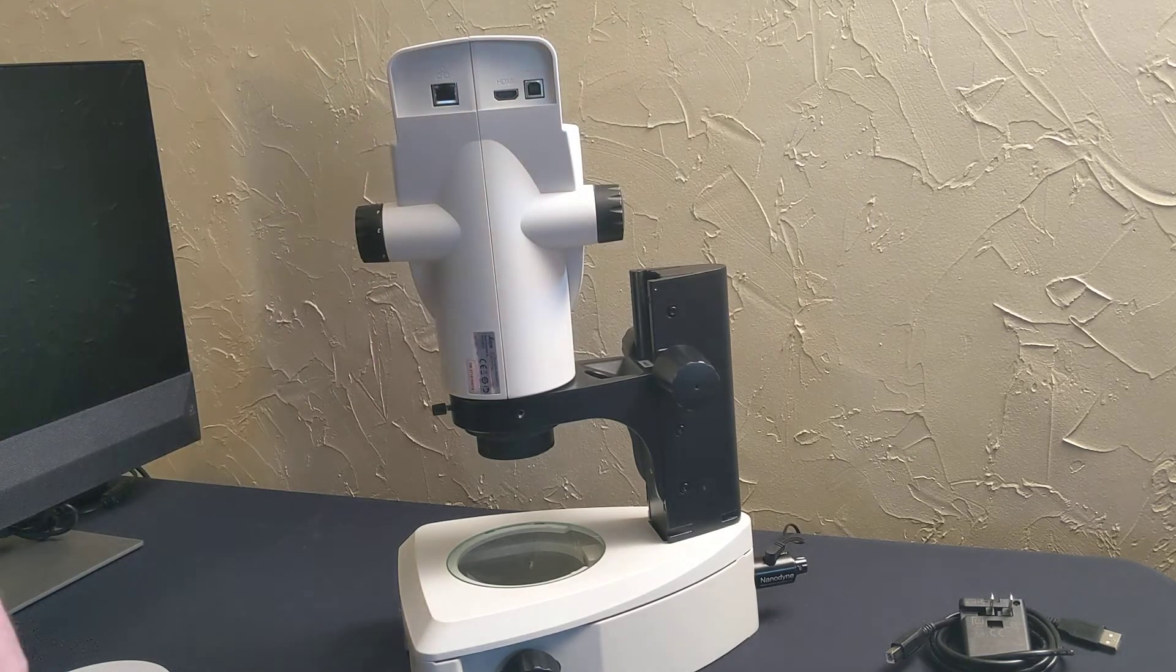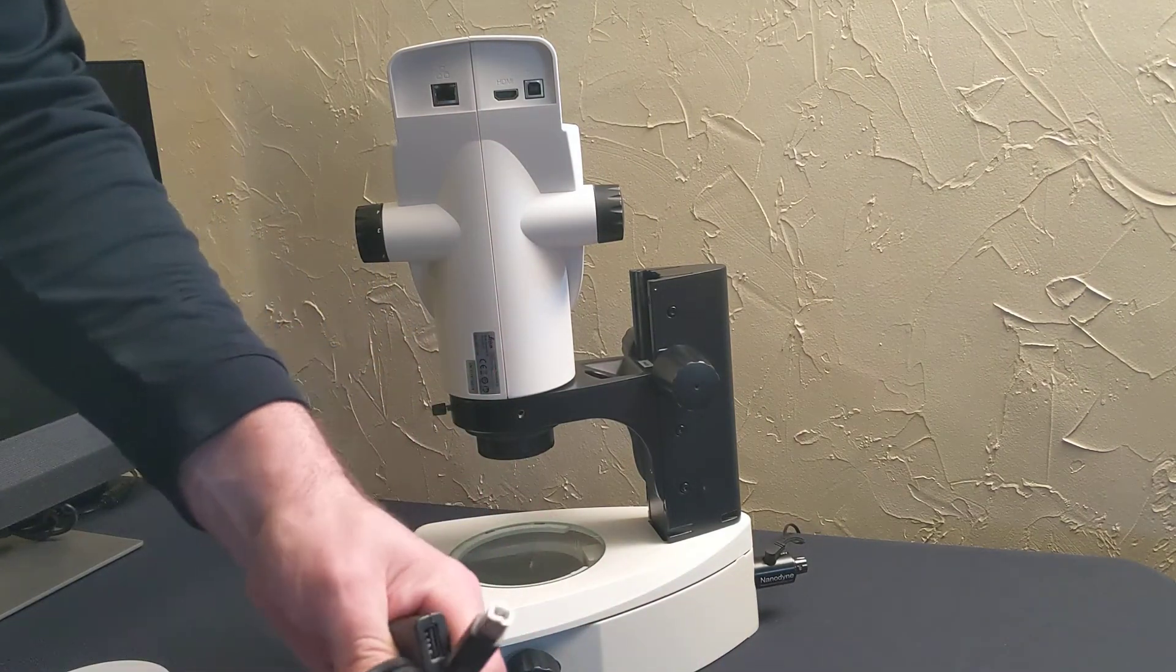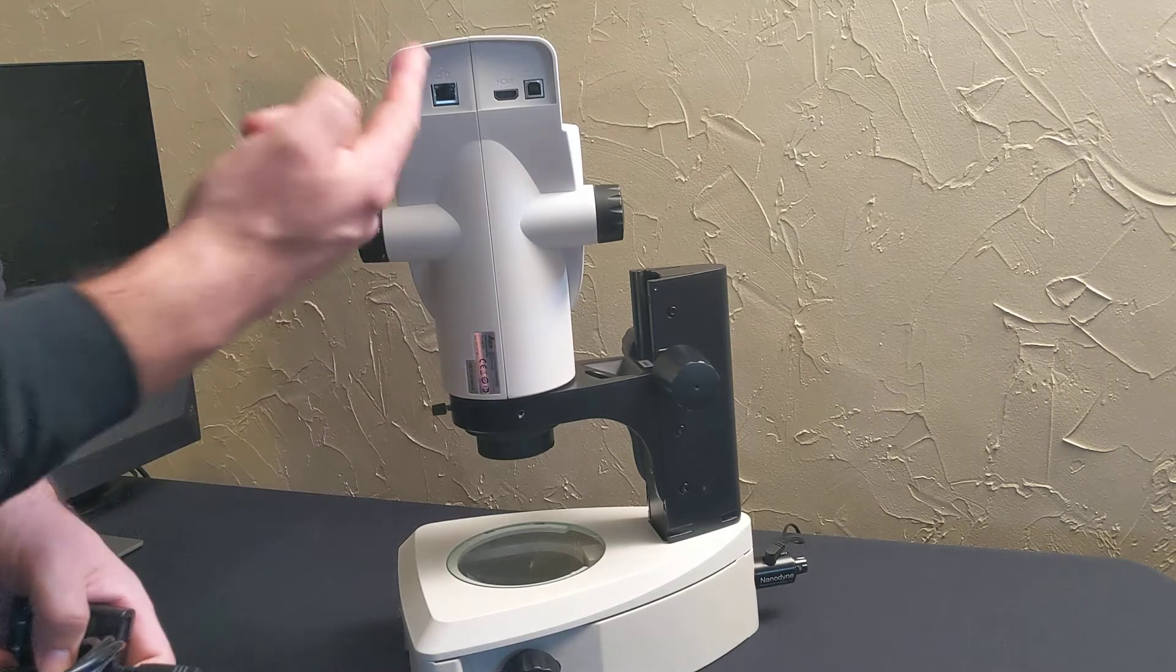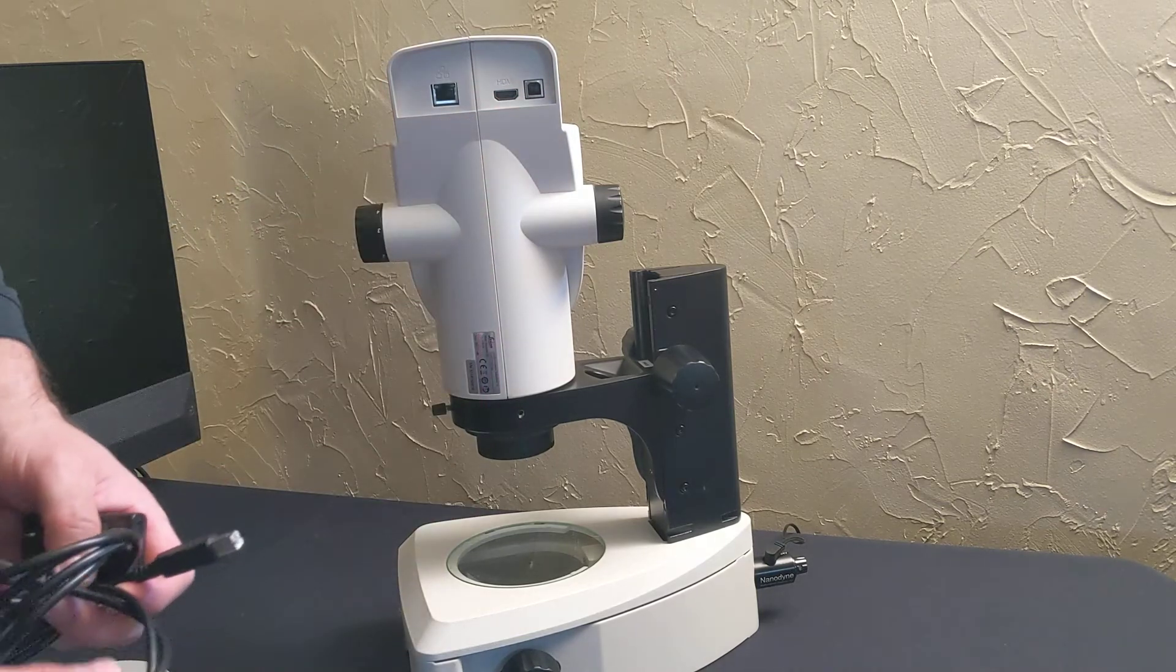the USB to power the camera. You have to give it power through the USB. There's a couple ways to do it - you can connect it through HDMI directly to a monitor or you can do it through USB directly to your PC or laptop, either way.